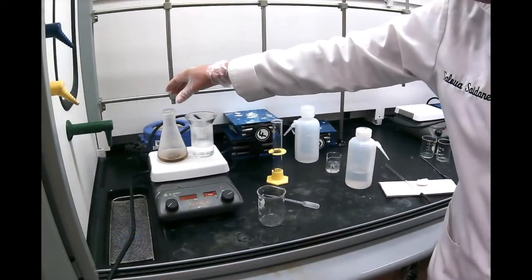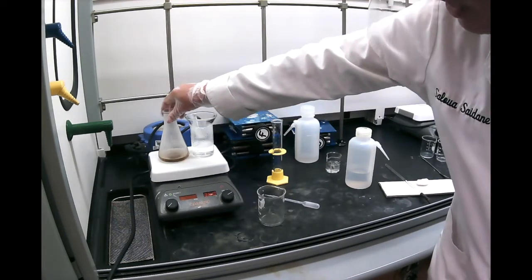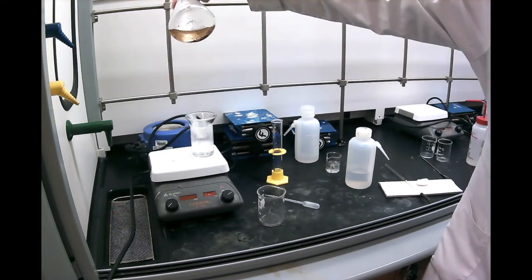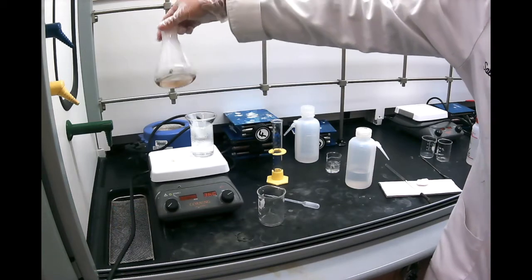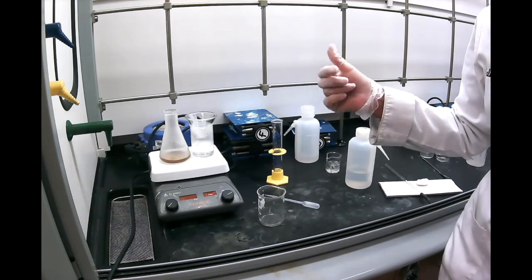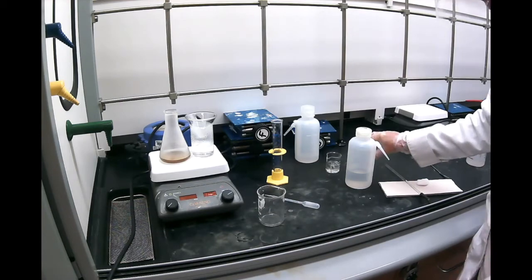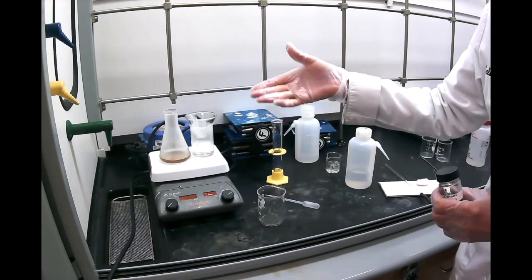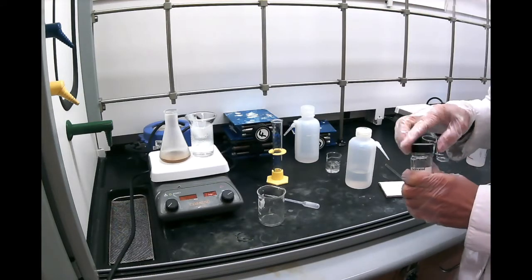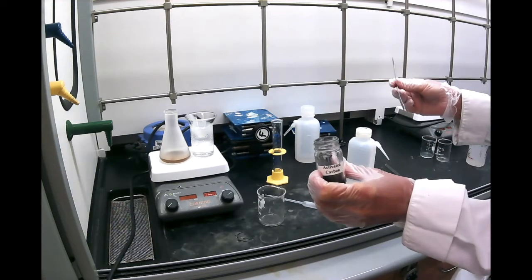So it's been a few minutes now, and you can see that the top liquid is colored and it's clear. But if I show you close up, you see there are a lot of insoluble impurities there. So what do we need to do? We need to get rid of both the insoluble impurities and the coloration. To take care of the insoluble impurity, we're going to filter it, of course. But for the coloration, when you read the handout, it says if your liquid is colored, use some activated charcoal.